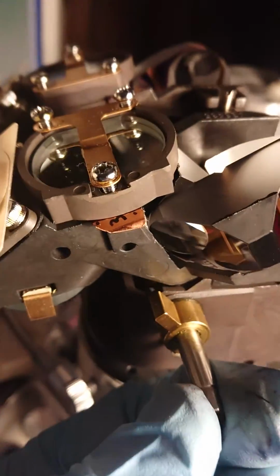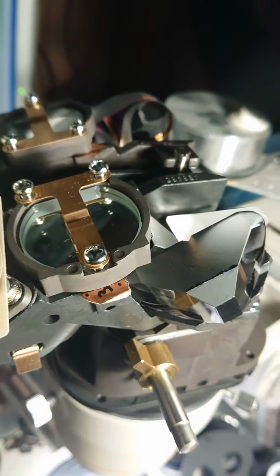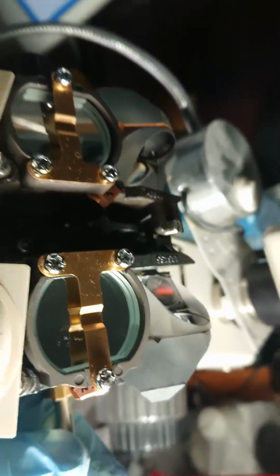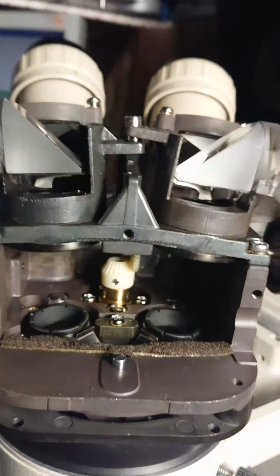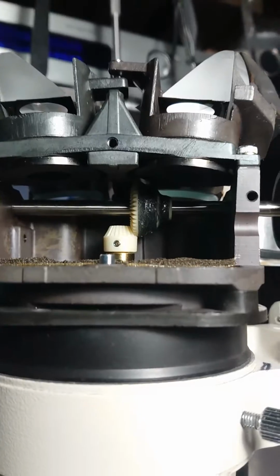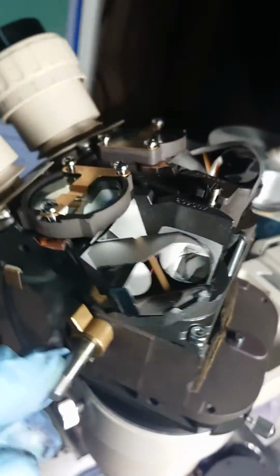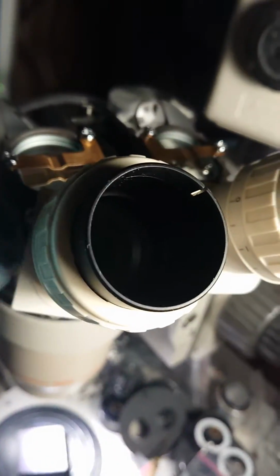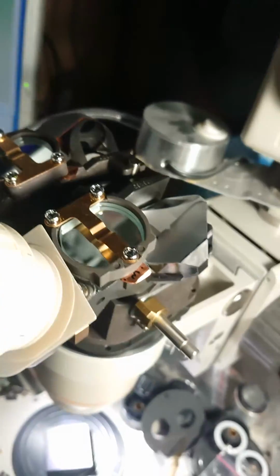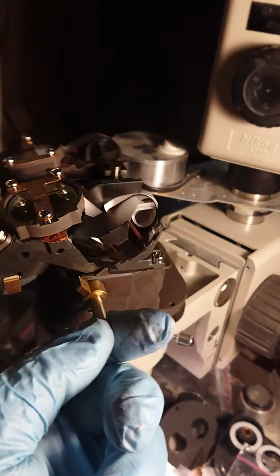And you can see foil pieces which adjust all the paths of rays through the channels, so that we can make everything set properly. Also, we can see the gear, strengthened with thread and epoxy here, then the side. So all parts are connected but still not adjusted together. A few last hours of adjustment are left, and after that the microscope is ready for use.